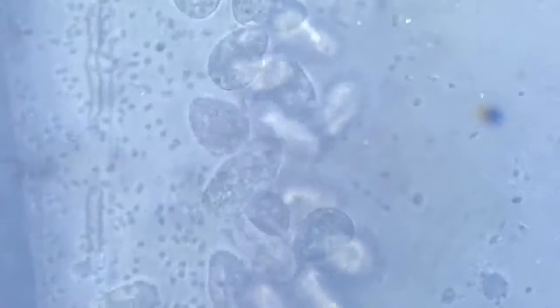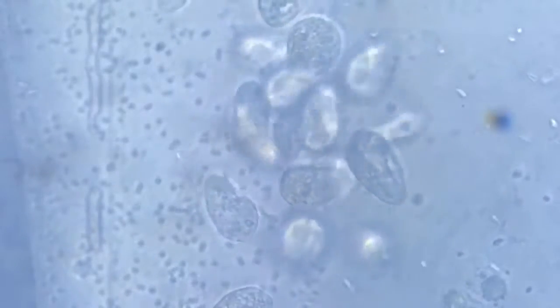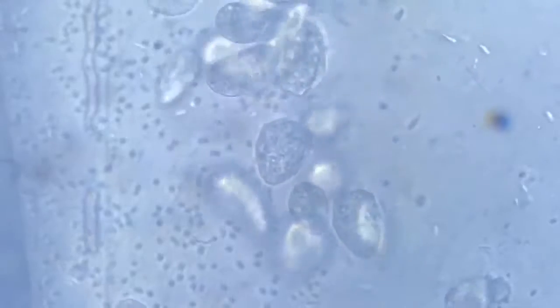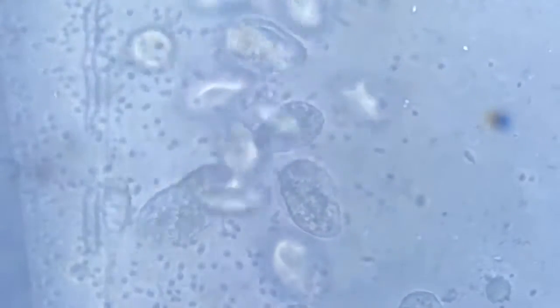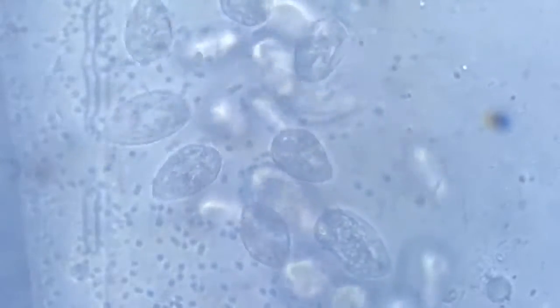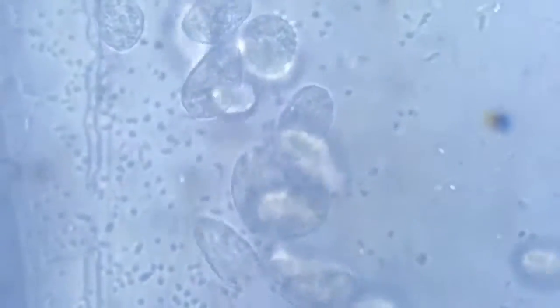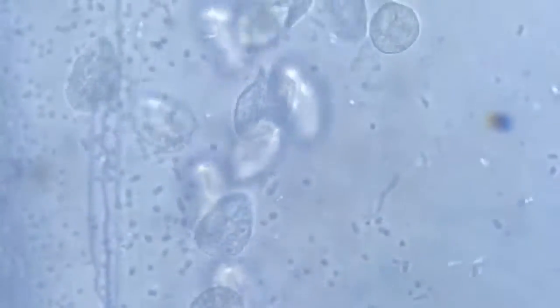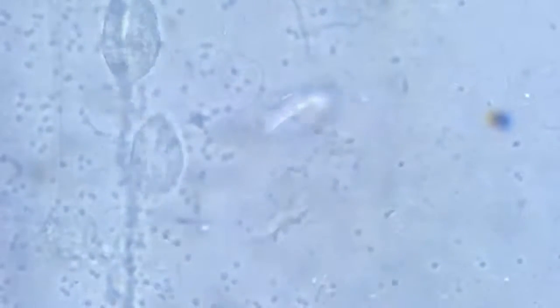All right, so in the given frame, we don't find any in the stage of conjugation or any other reproductive action. But there are many of them here, so we are quite hopeful. We keep the search on and we keep proceeding. Sorry for that little technical glitch.